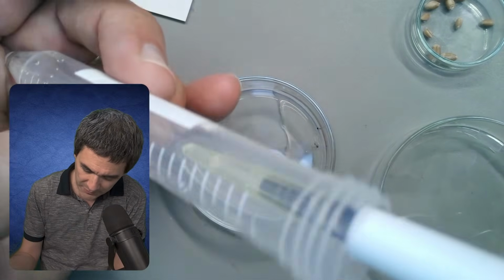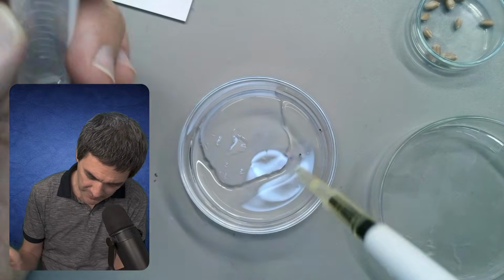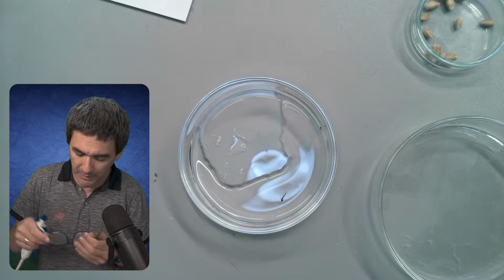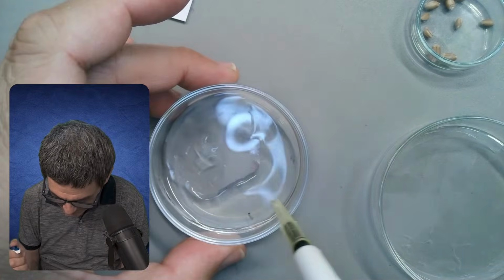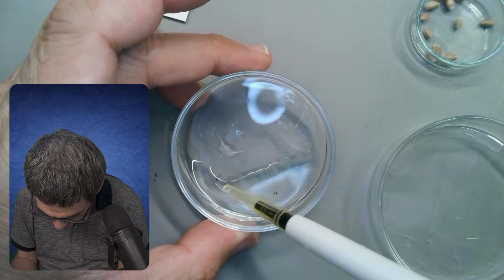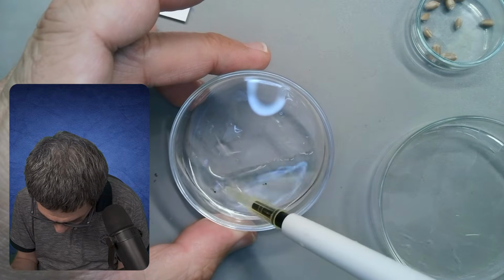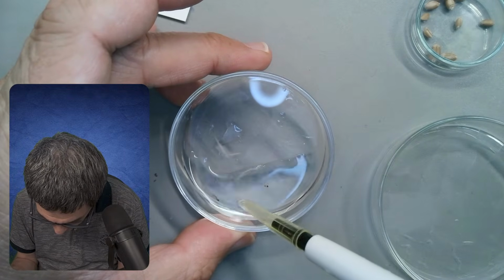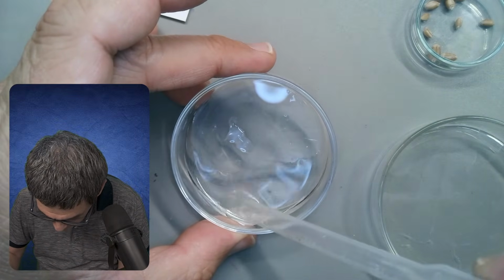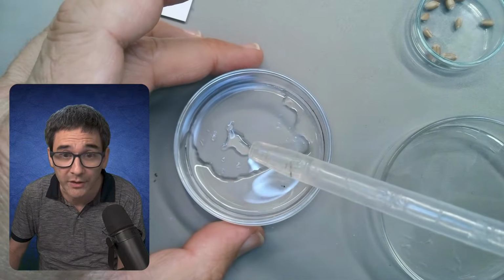I'm going to add some more water here. Let me see. I need glasses, because my vision is much better with them. So let's have a look. I'm able to catch this one here. See, they're so fast. Nope. Almost. No. Nope. I will try a different one. I'll try this one over here. Yep, here we go. I got it.